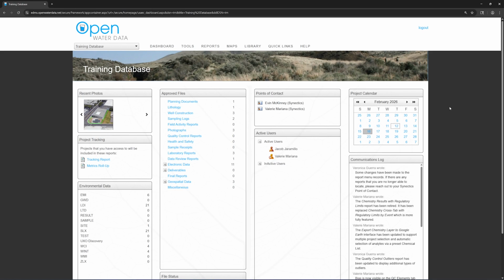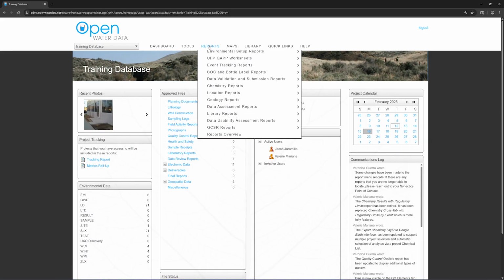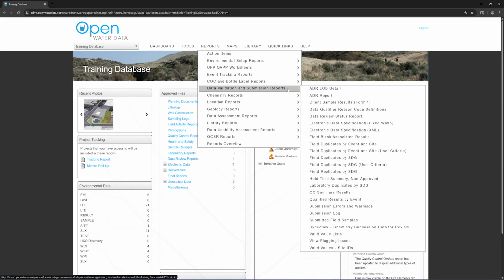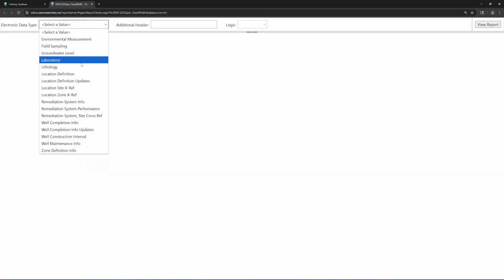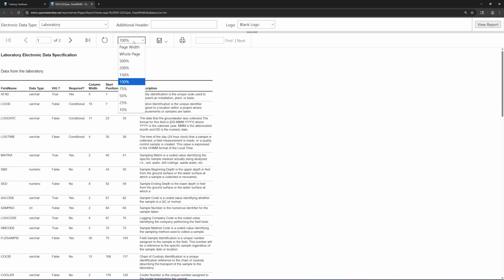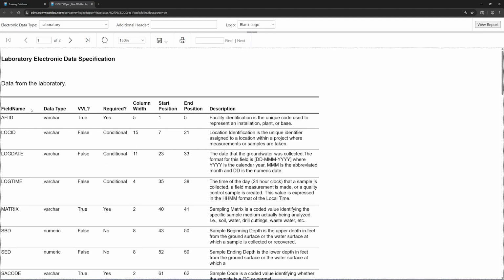We can check this format for our data by going to Reports, Data Validation and Submission Reports, Electronic Data Specification Fixed Width. Choose Laboratory and click View Report. This report tells us the field name: what fields need to be included in the file. Data type: the type of characters the field will accept. This is defined at the bottom.